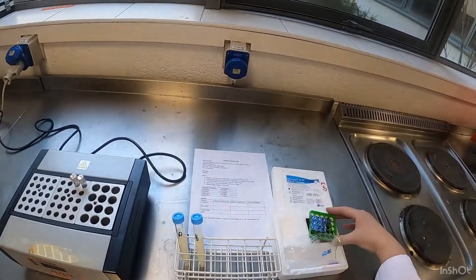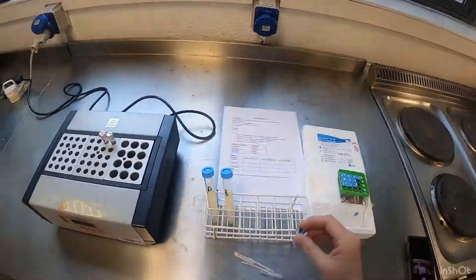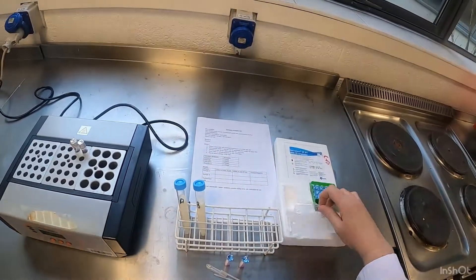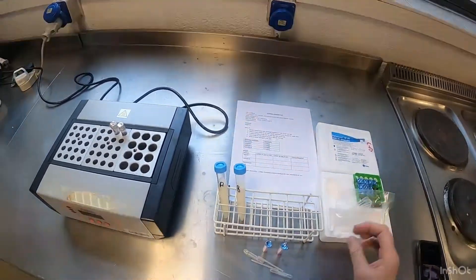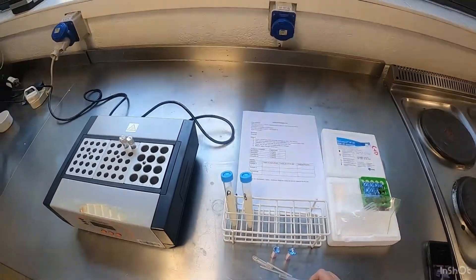When you open up the test kit you'll have ampoules such as this, so they're purple in colour and I've broke off two ampoules and I'm going to put them here. Also you'll have little pipettes for pipetting your sample of milk into your ampoules.